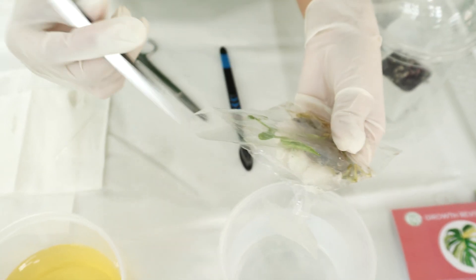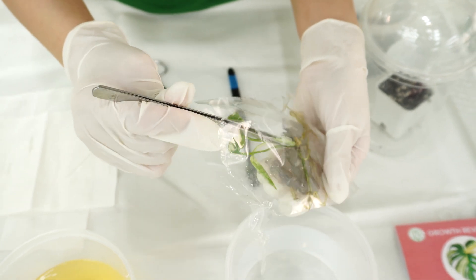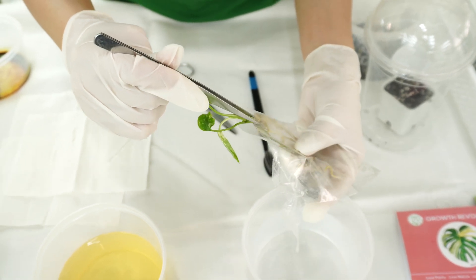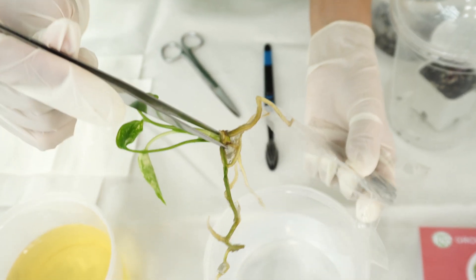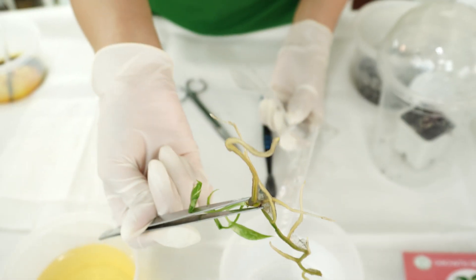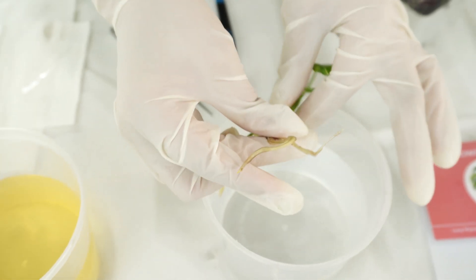While taking the plant out, we're going to use the tweezers to carefully remove it from the plastic container. As you take it out, make sure you try to get rid of the gel or agar remaining in the plastic container, then drop the plant into our water container.